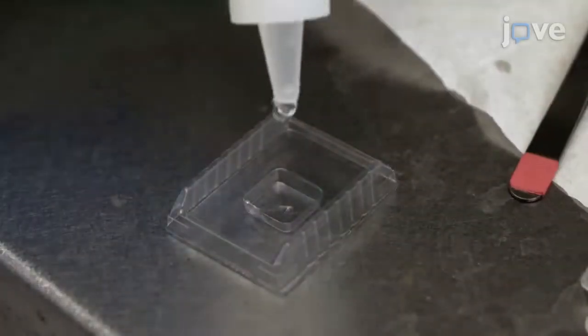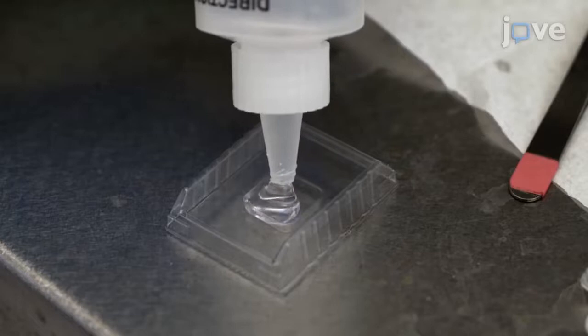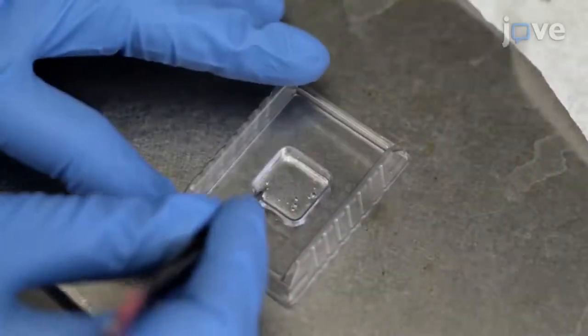Fill the mold approximately half with OCT medium and gently mix the embryos in it.